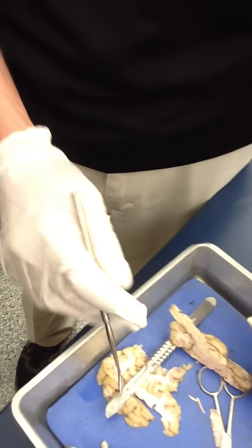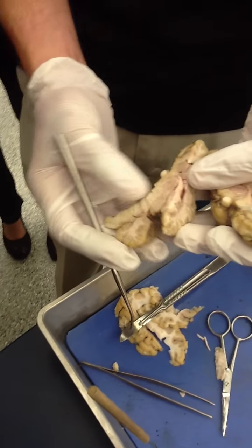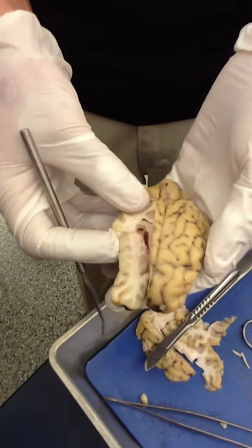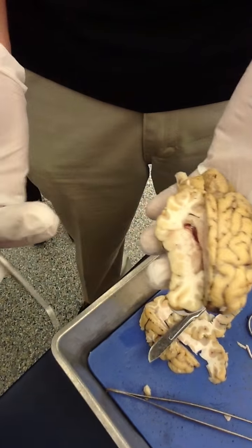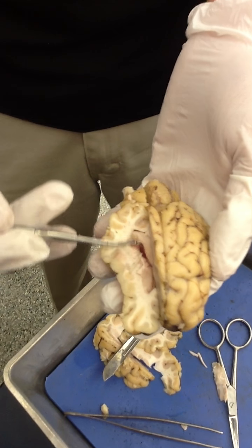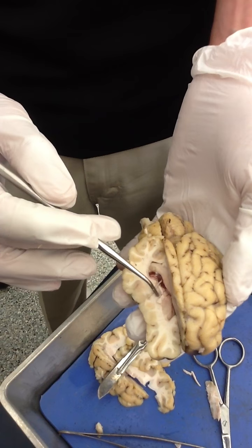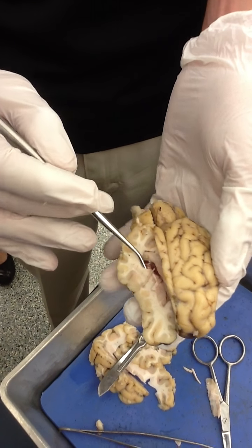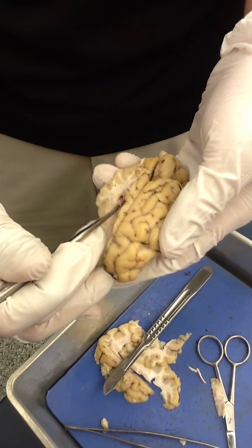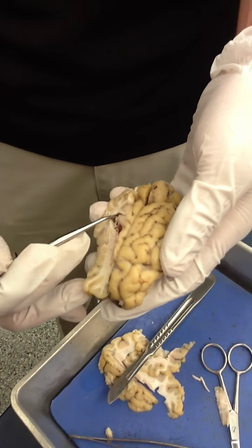If we look here, this is the other half of the brain, and I have removed the superior portion of the cerebrum here just over the lateral ventricle. So this space would be the lateral ventricle. I'm going to lift some of this up and show you — that's the actual space in there.